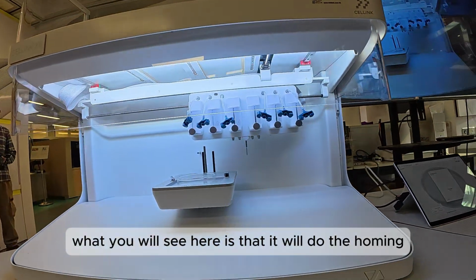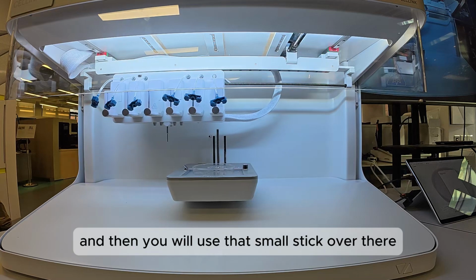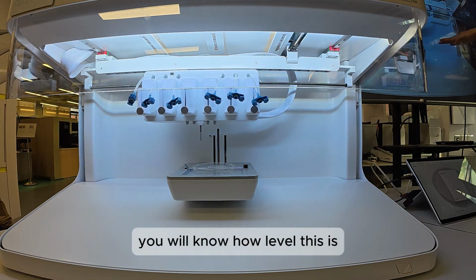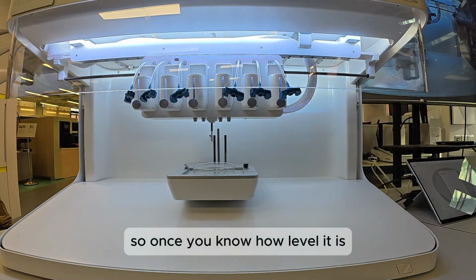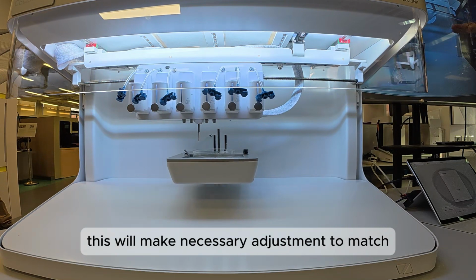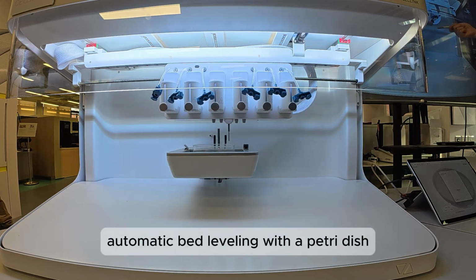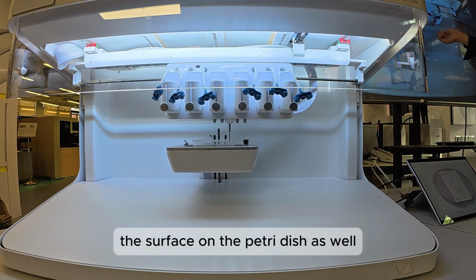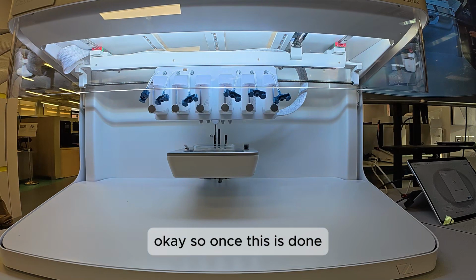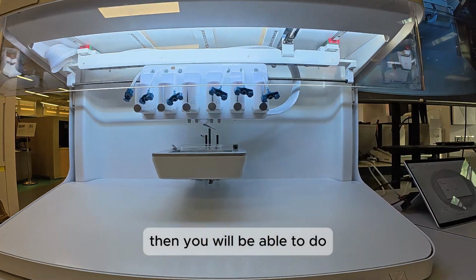Alright. What you will see here is that it will do the homing, and then it will use that small stick over there to take 3 points, and from the 3 points, it will know how level this is. So once it knows how level it is, when you print the construct from left to right, it will make necessary adjustment to match. We do the automatic bed leveling with a petri dish to take into account the surface of the petri dish as well. But even if you want to do it without the petri dish, that's fine too. Okay, so once this is done, then you will be able to do the calibration.